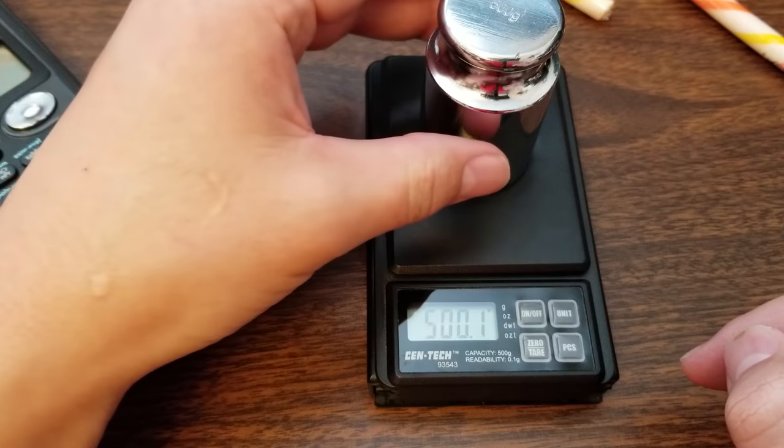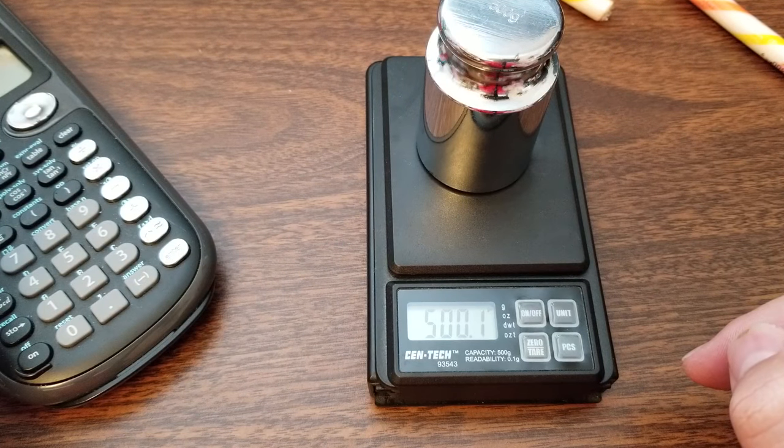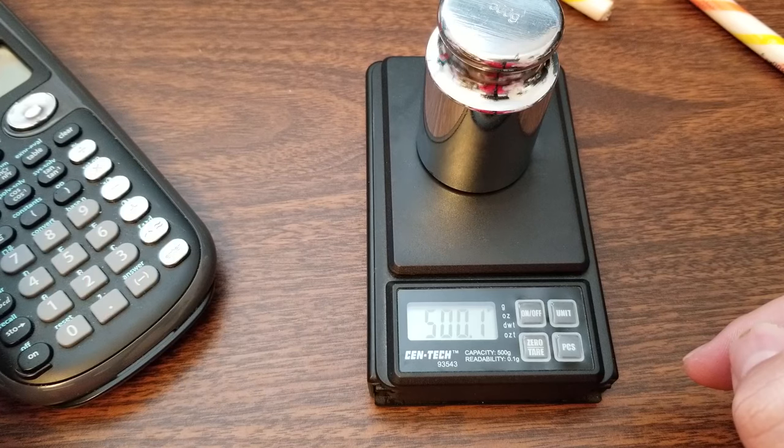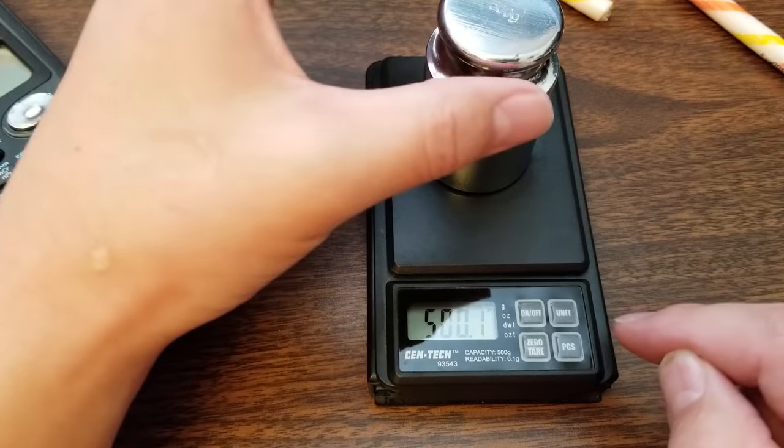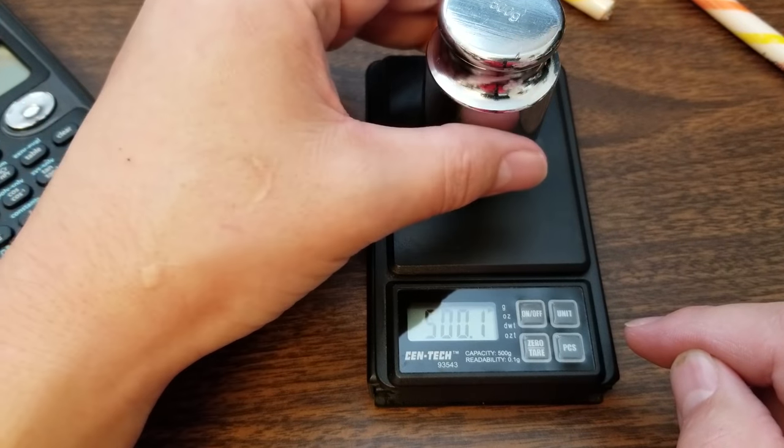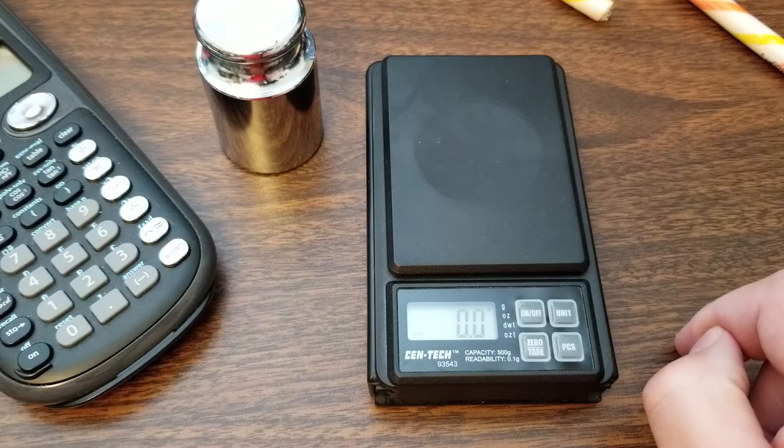Pass. All right. Oh. Maybe I went in too quickly. Okay. Let's see if I can take it off. And there we go.